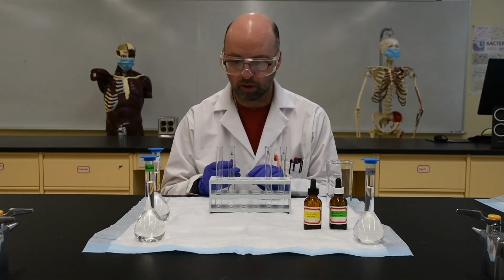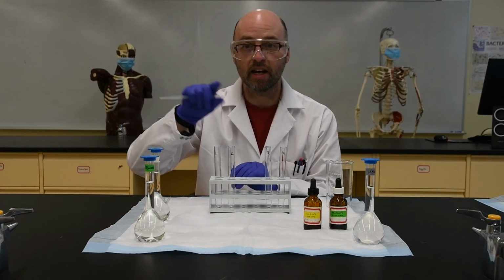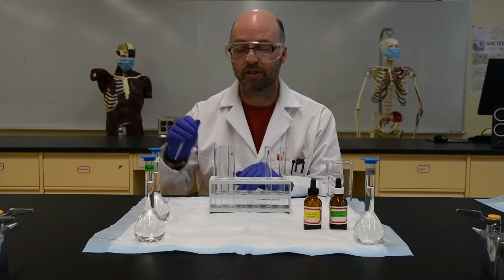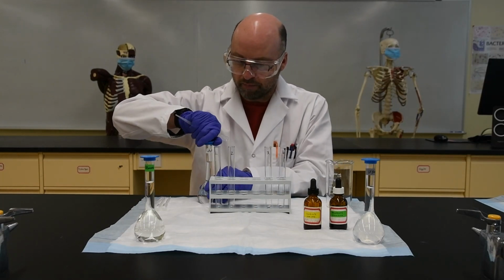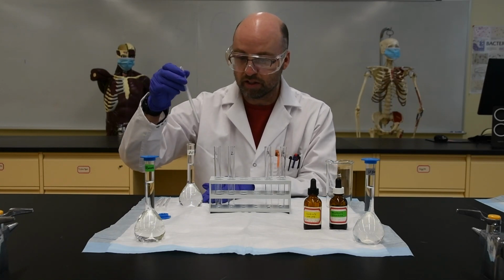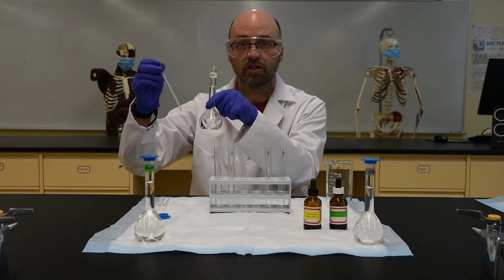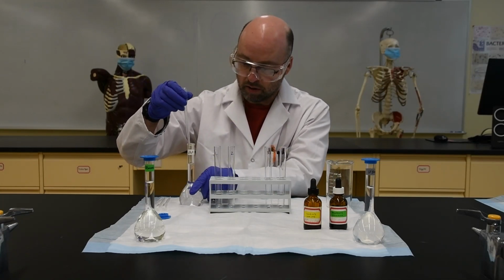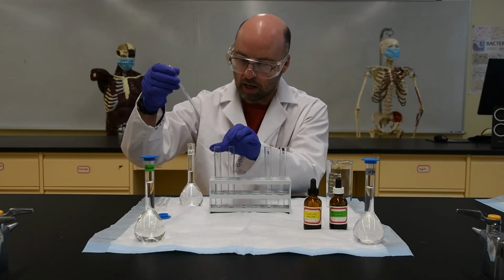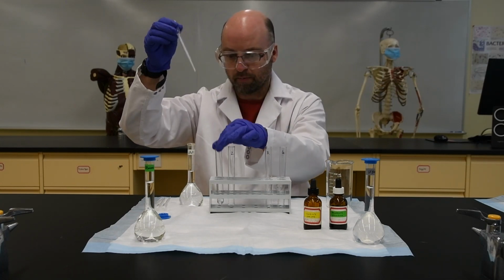So what I'm going to do here is take test tube number 1, and you have a little table that we sent you on Moodle for you to fill in as we go along what the results are. So the first one, if you follow along on the protocol that you were sent on Moodle, you'll see that I have to add about 1 ml of simple water. So this is just distilled water, nothing in it, and I'll add about 1 ml of that water to this tube. Okay?